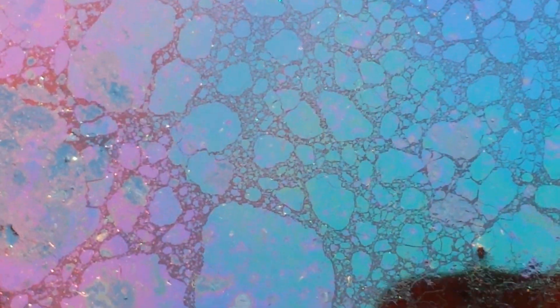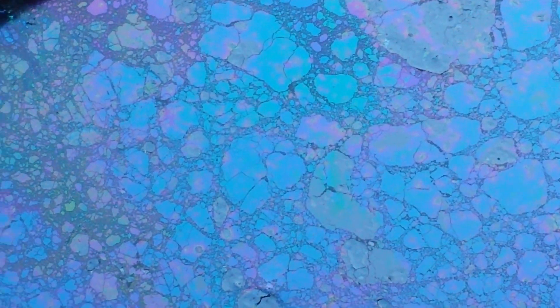They have a very metallic, interesting sort of sheen to them where they look oily. That's graphene, or graphene oxide more correctly.